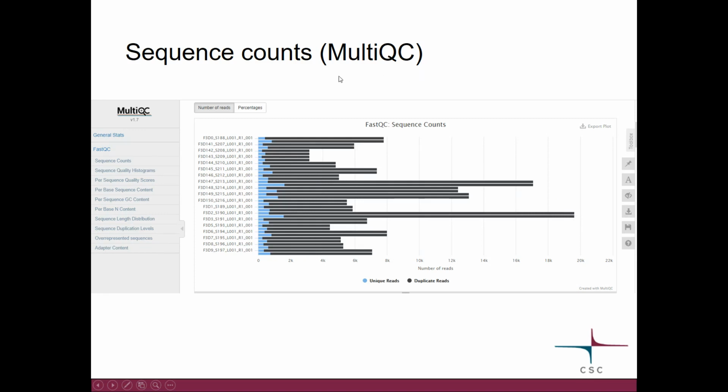MultiQC also colors these bars so that it shows what proportion are duplicate reads, so they are identical, and which ones are unique. And here you have the toolbox that I mentioned earlier. If I click here, that would open the toolbox, and I could, for example, highlight some samples.